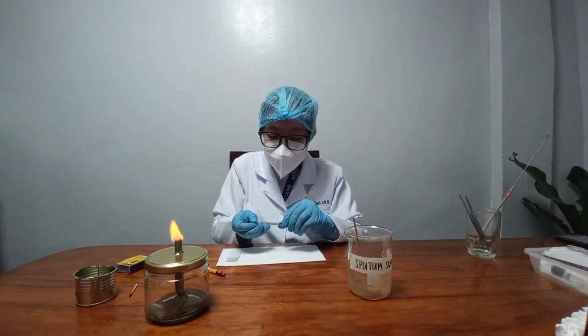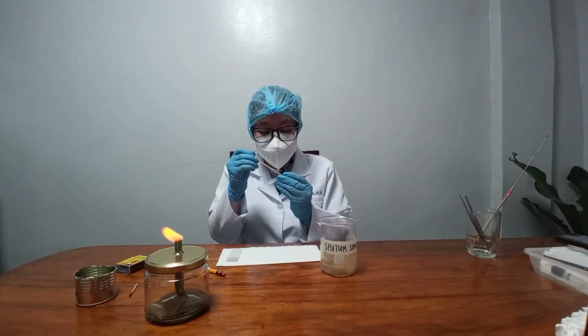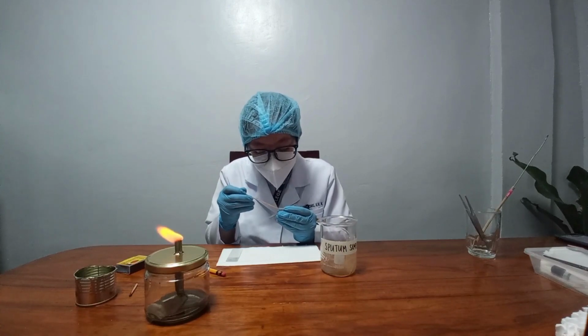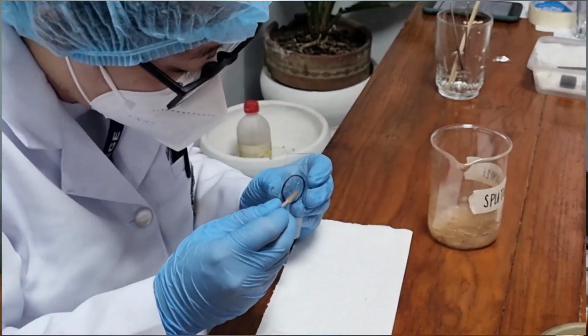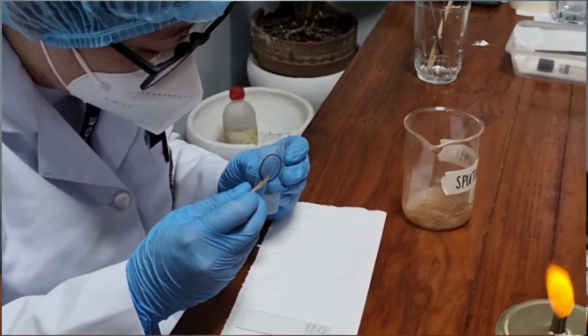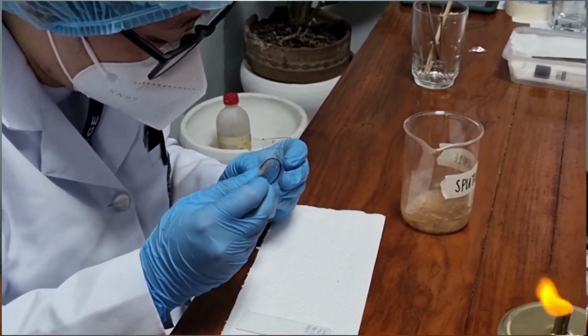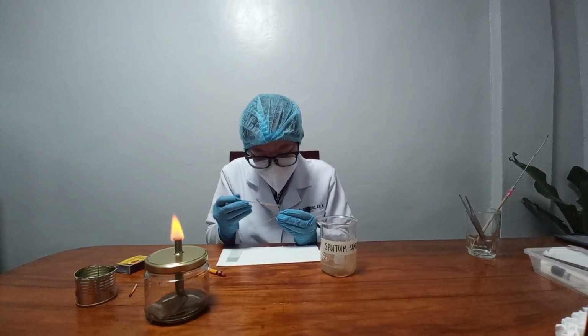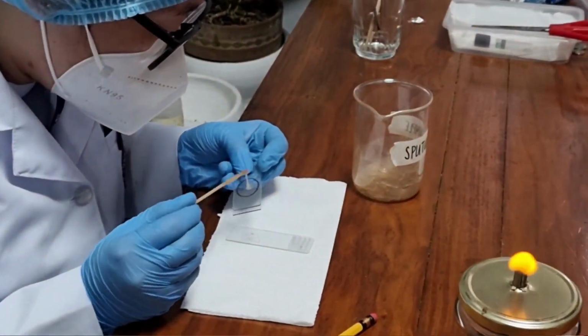In making a sputum smear, fish out 1 loopful of yellowish particle of sputum and spread evenly on a slide with an applicator stick. Remember to use the 2 cm by 3 cm template in preparing the AFB smear. When smearing for AFB, create small concentric circles or coil-like patterns.